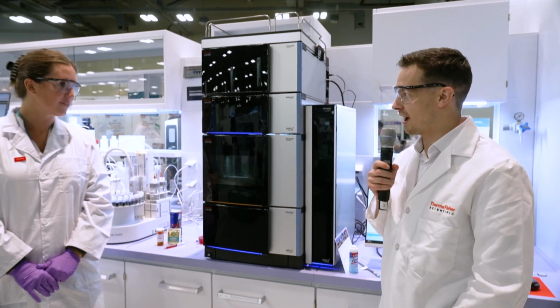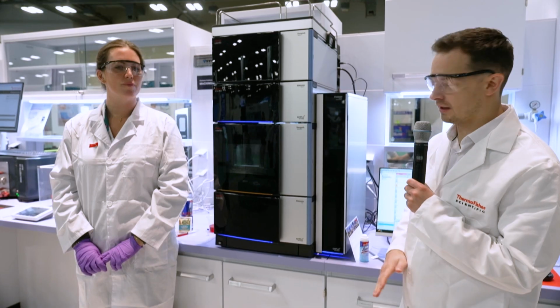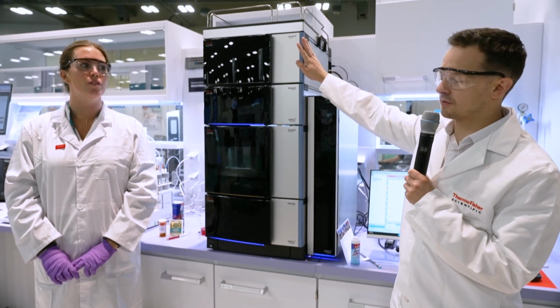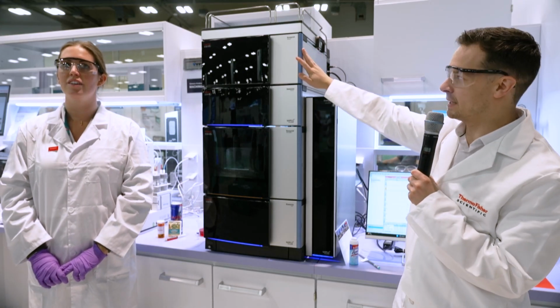Hi, thanks. I'm joined here with my colleague Monica, and we're here to show off the Vanquish LC system and our Charged Aerosol Detection, our latest one, which is the Vanquish CAD P Series.